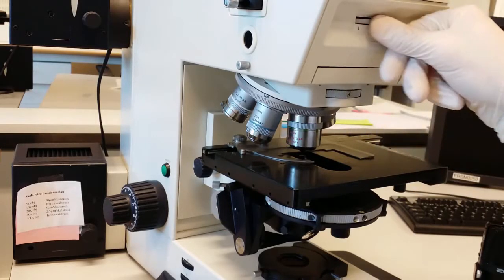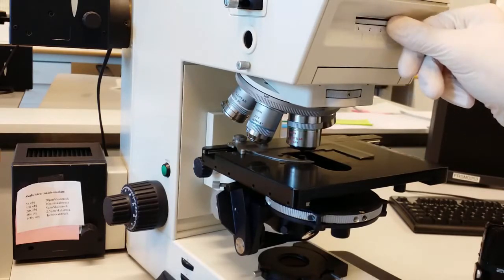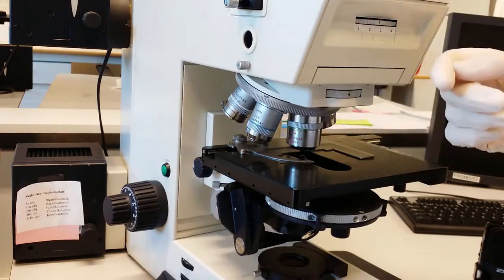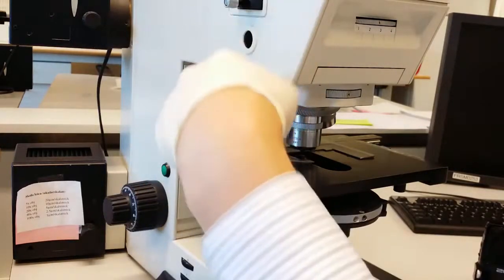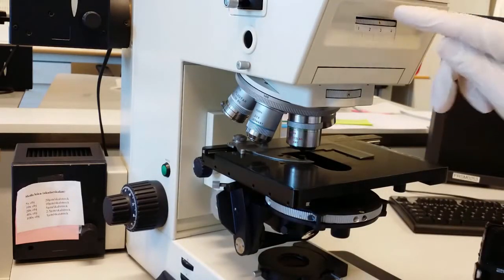The top one here is a reflector, 1, 2, 3, 4. Here you choose how the light shall be reflected inside this microscope. It is used when you use reflective light, because then the light comes from the light source over here and goes through here, down through the objective, and then it reflects back upwards again. So how to collect this light is governed by this reflector.